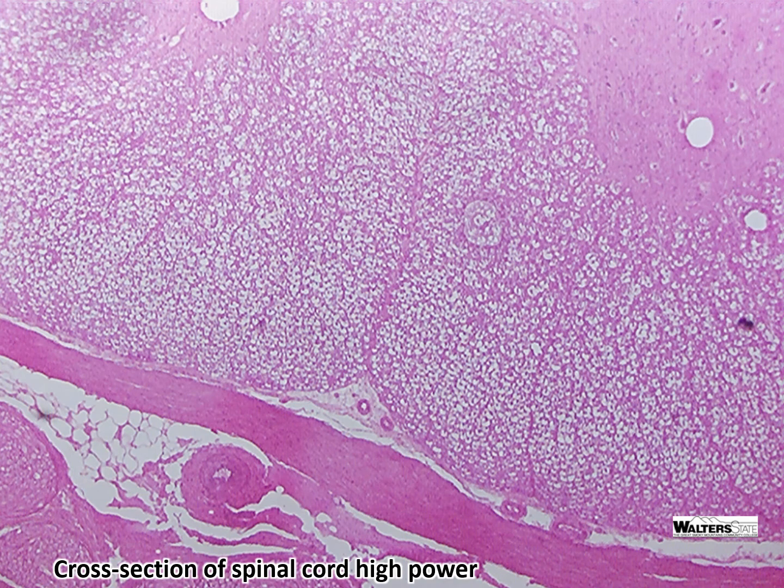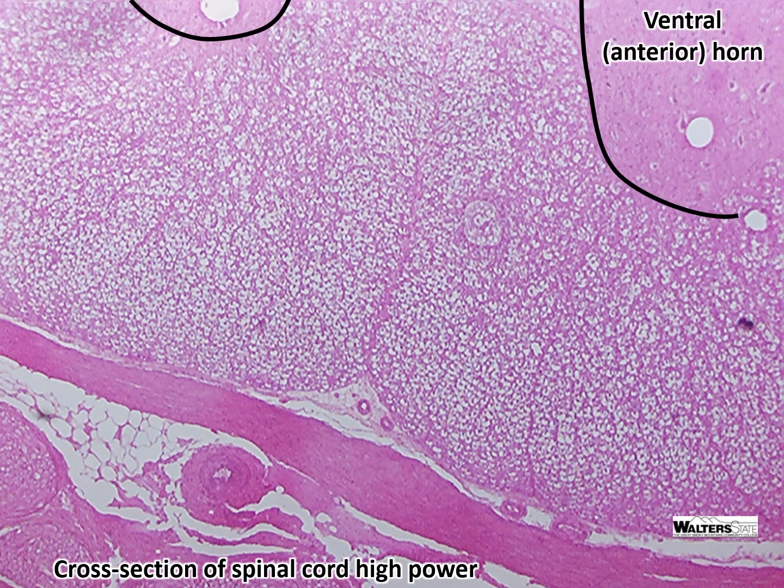If we take a closer look at the cross-section of the spinal cord at high power, there are a number of things that we can see. First of all, this is part of the ventral or anterior horn. This is white matter, so you may be able to make out individual axons with myelin surrounding them.